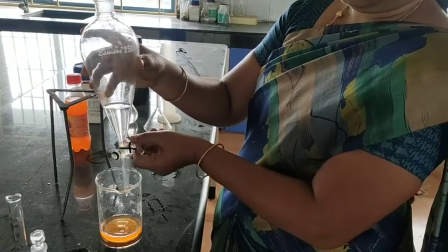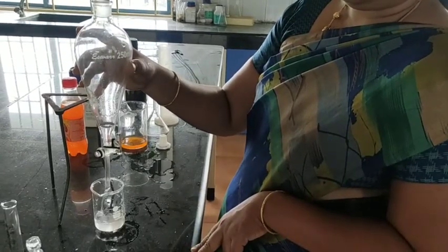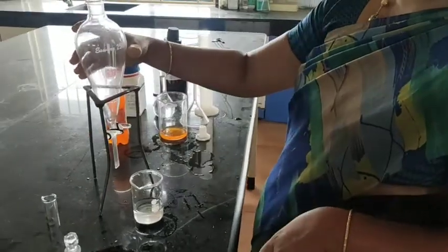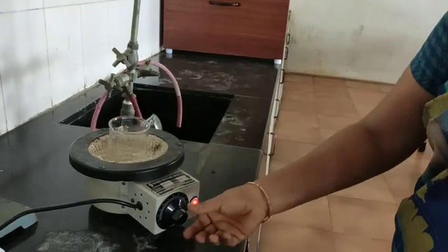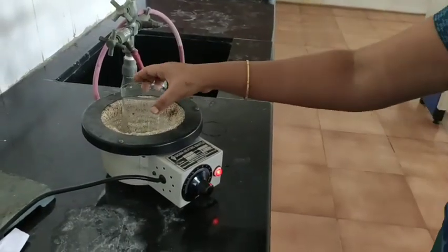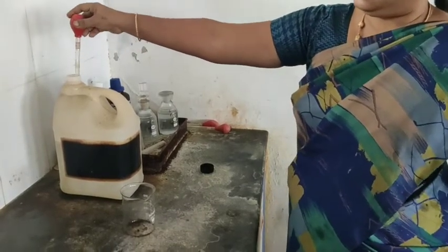We have to remove the colored sample layer as that is not needed. Only the diethyl ether portion is needed for saccharin estimation, and that we have to collect. The extracted ether should then be heated over the hot plate to dryness.